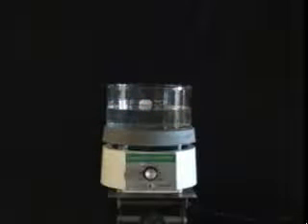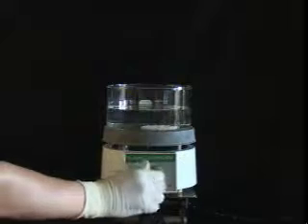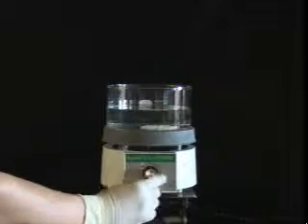You will need a hot water bath for the solubility tests as well as the recrystallization. Caution! Organic solvents are flammable. Never heat over an open flame. To set up a water bath, place a large crystallizing dish about half full with water on a hot plate. Add some boiling stones and turn on the heat. Don't turn it up all the way. Start halfway and adjust from there.